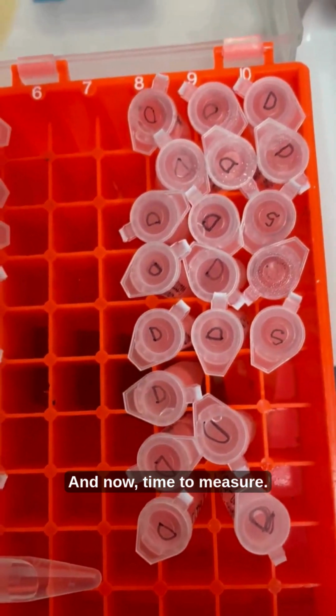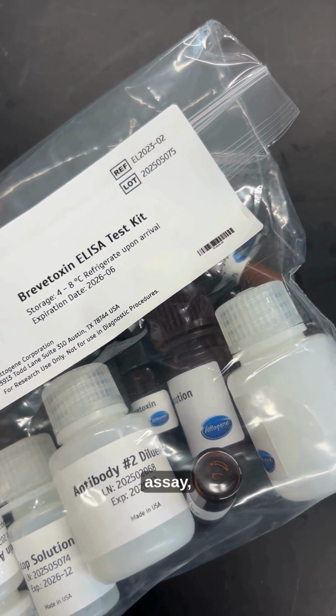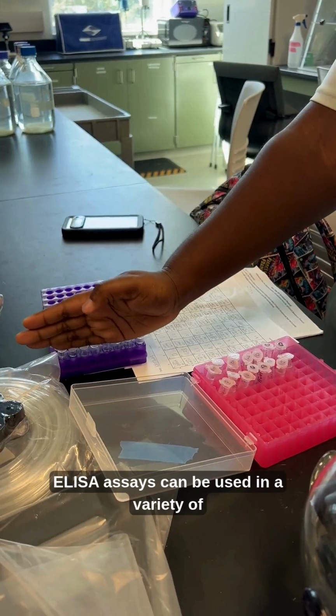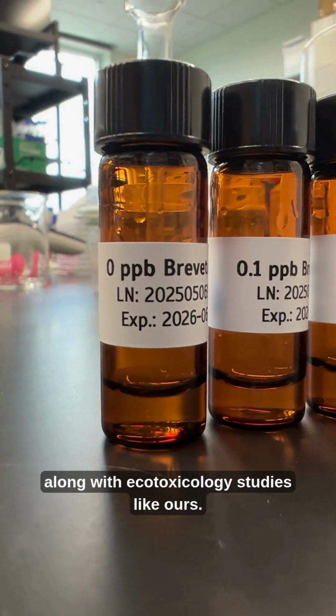And now, time to measure. We perform an ELISA, short for enzyme-linked immunosorbent assay, which is a procedure used to quickly measure brevetoxin concentrations in liquid samples. ELISA assays can be used in a variety of research, along with ecotoxicology studies like ours.